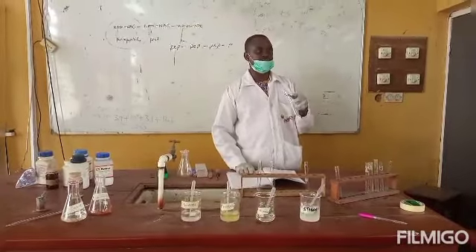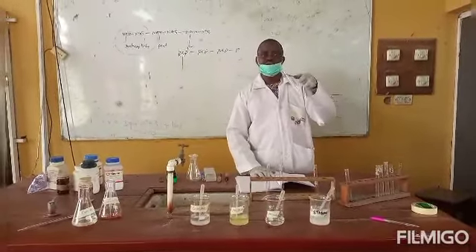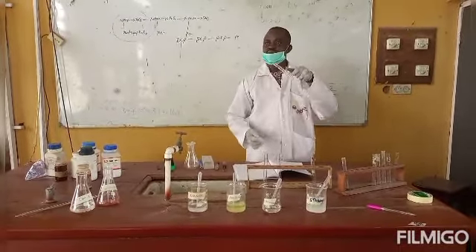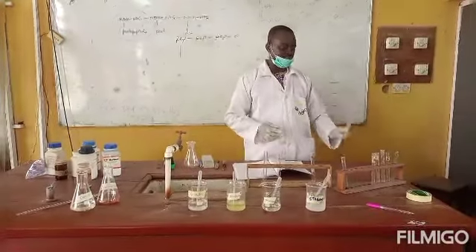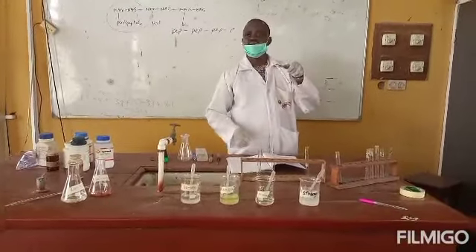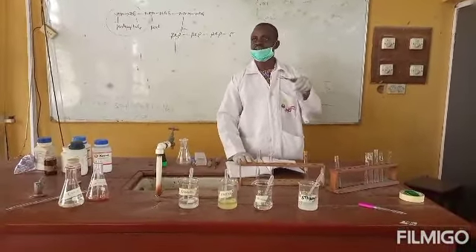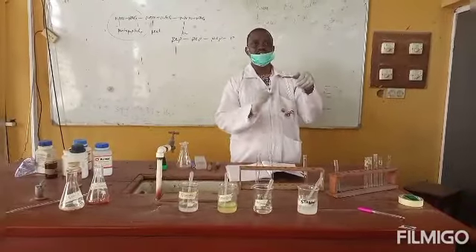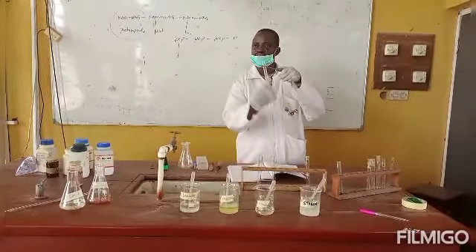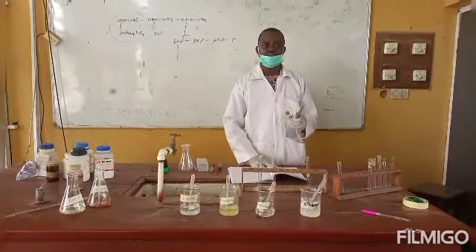That is, the dehydration of the carbohydrates, if it is pentose, to furfural will be formed. As a matter of fact, a ring coloration will be seen separating 2 layers. The color of the ring depends on the type of carbohydrate, whether it's a monosaccharide, disaccharide, or polysaccharide. But the more monomeric units in that carbohydrate, the more intense the color of the ring will be. So basically, that's how to test for a compound containing carbohydrate.